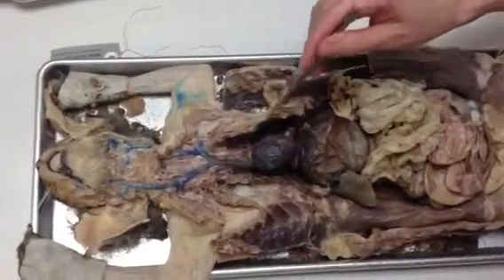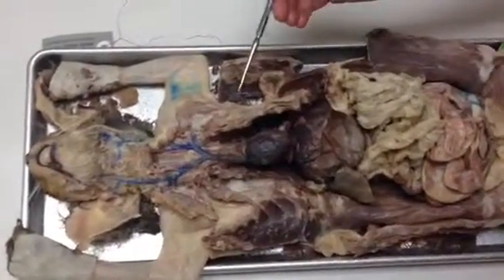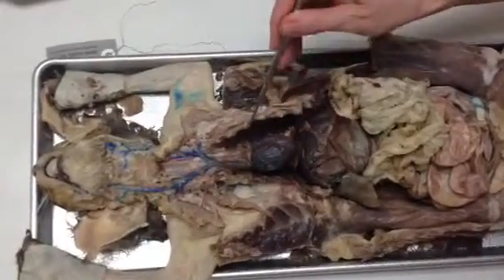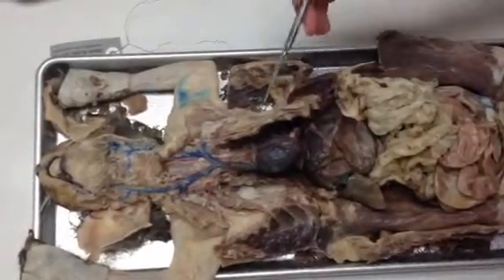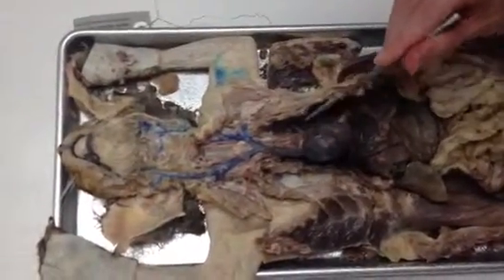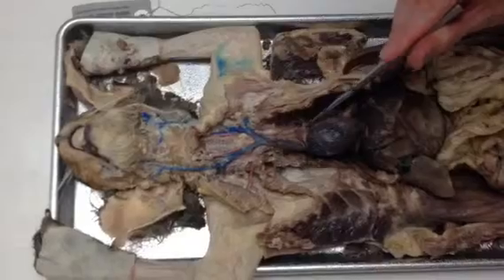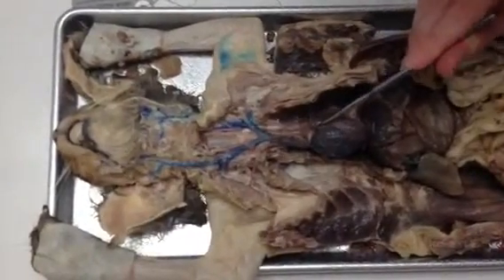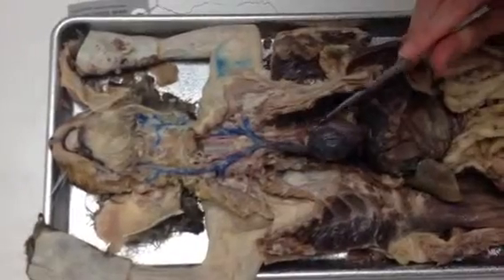The top half of the cat. All right, we're going to start with the arteries. So with the arteries in the top half of the cat, we're going to go right off the heart. Off the heart, we have the aorta, which is a little bit difficult to see. But that comes, of course, off of the left ventricle. And no, that's the pulmonary right there.